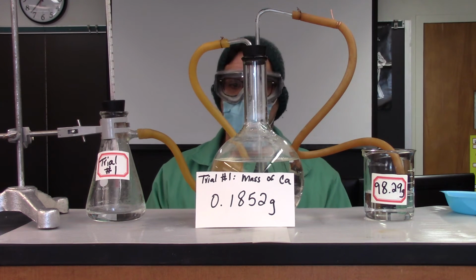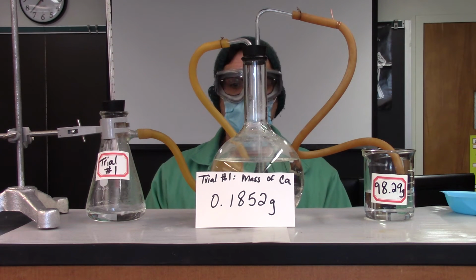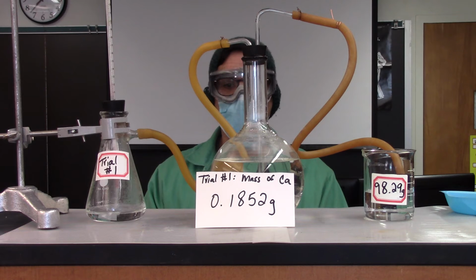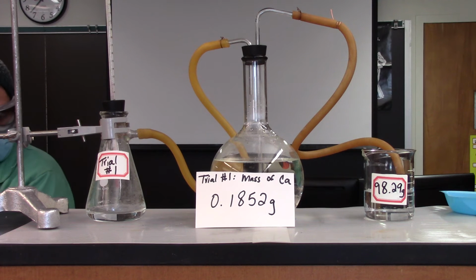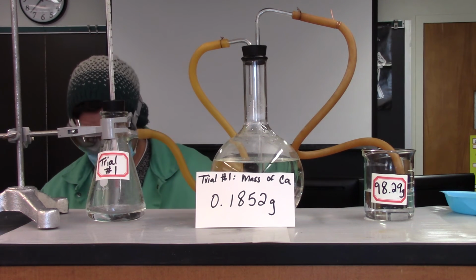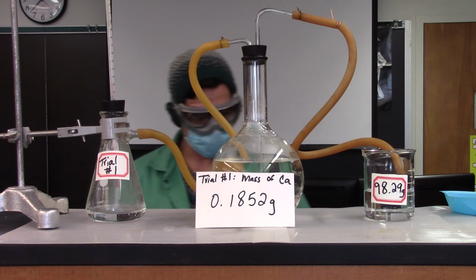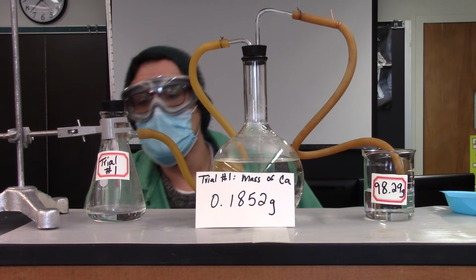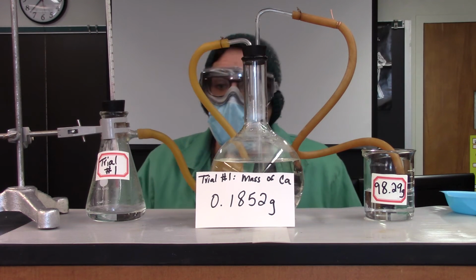Looks like it's almost done. Still going a little bit.